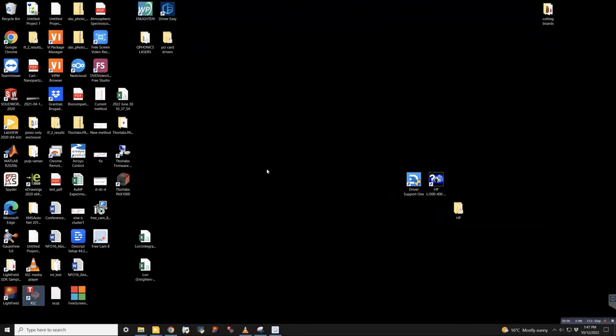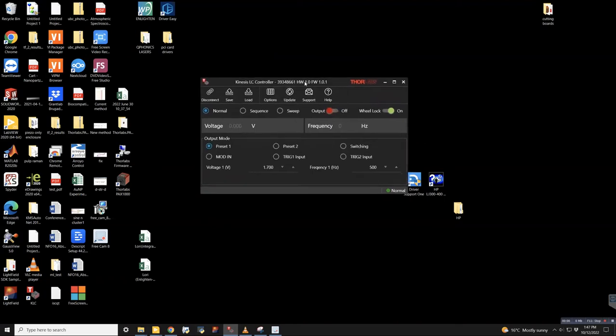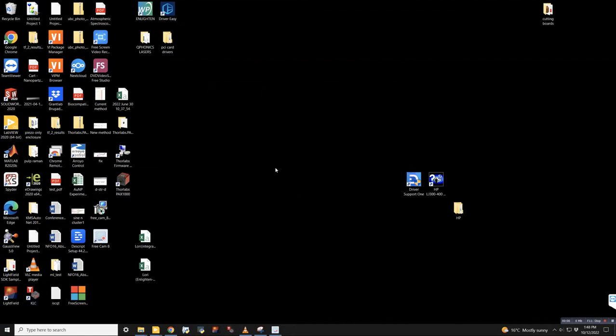The other one is this KLC software. Sometimes when there's problems, it's good to open this piece of software up and try to connect to the instrument. So here, when you see these kind of options, that means you can connect to it, that the driver is available for Windows. And the only way that I've been able to really get it to work with LabVIEW consistently is if you hit disconnect here. And what you'll see is that it's gone completely. And at this point, we should be able to reliably connect to it through the LabVIEW interface.